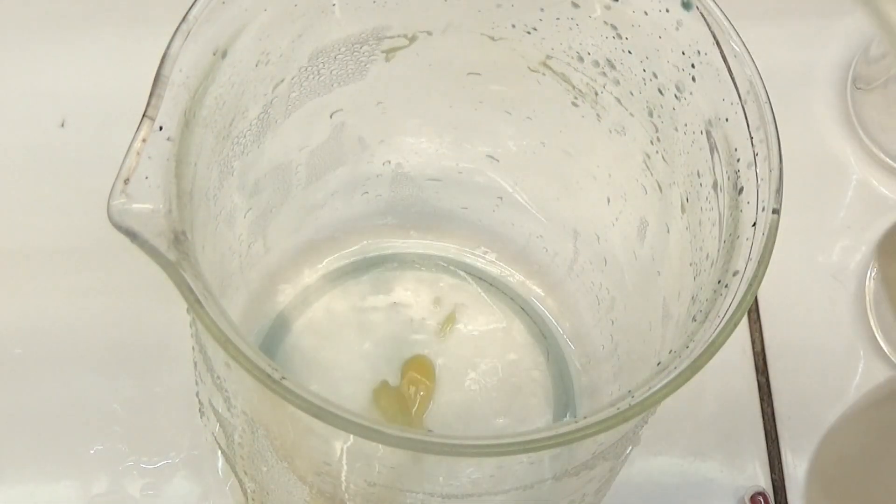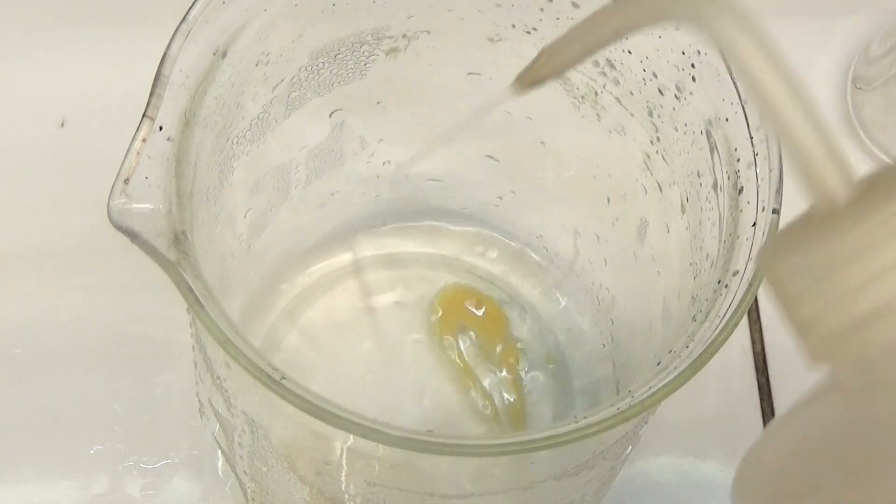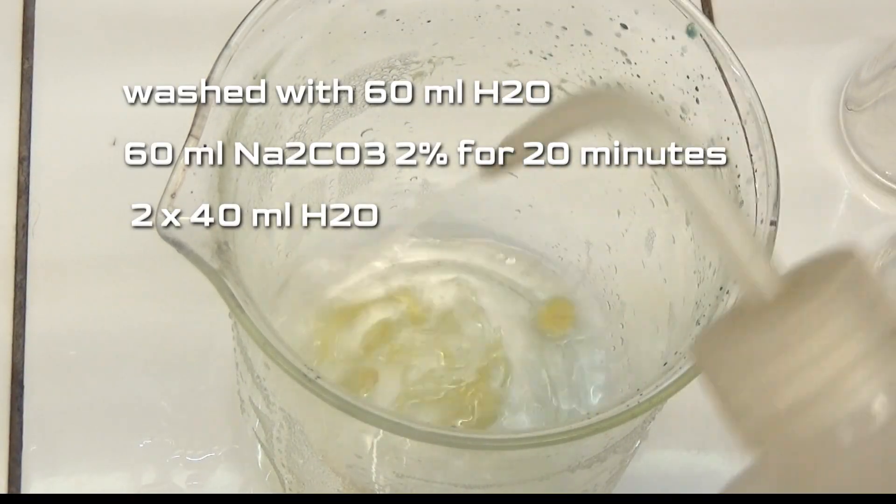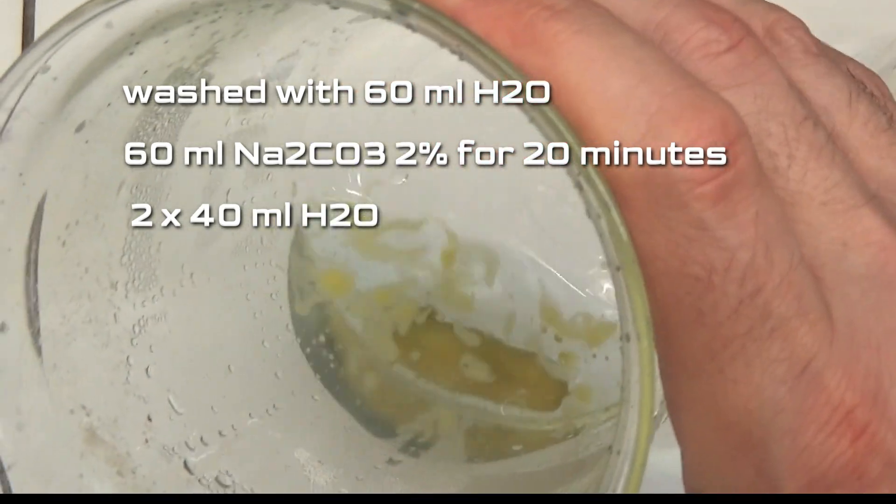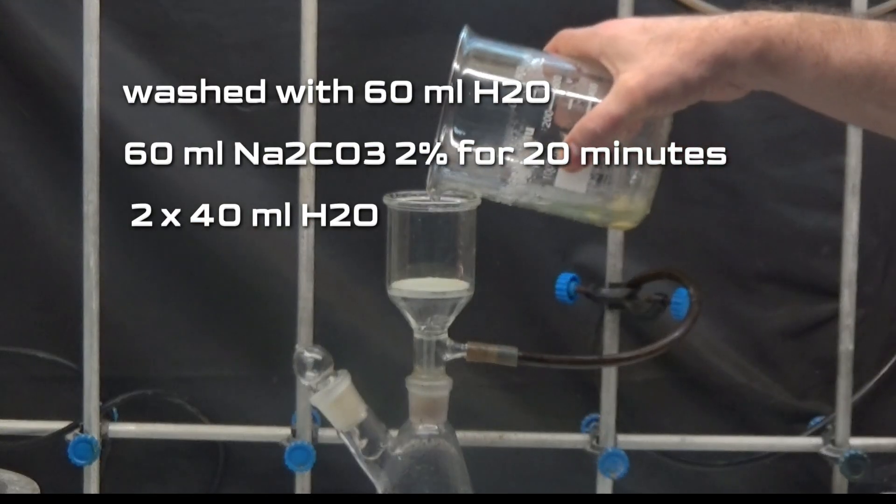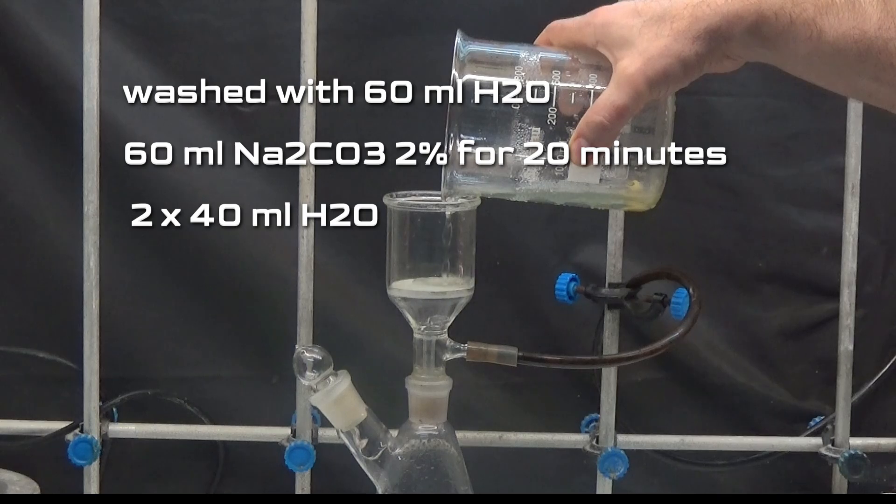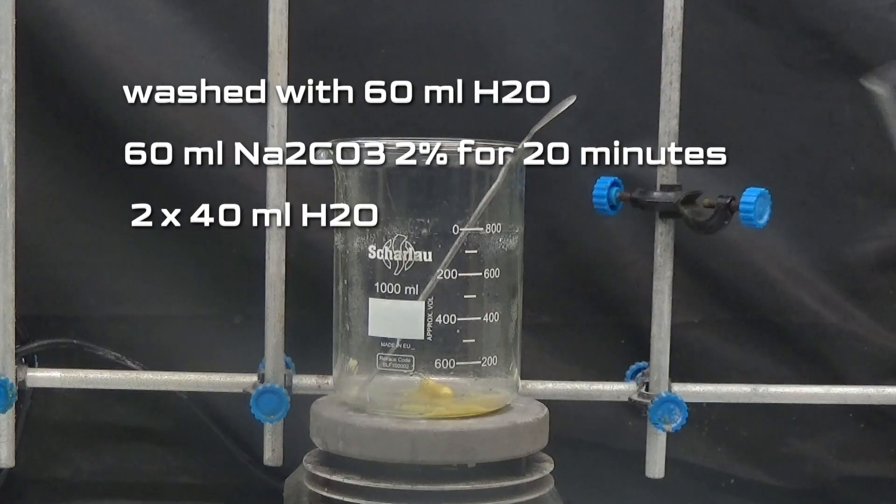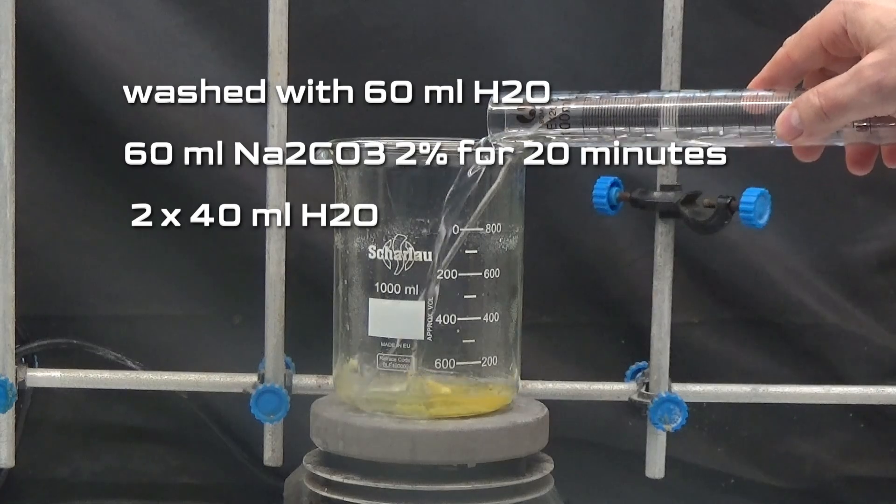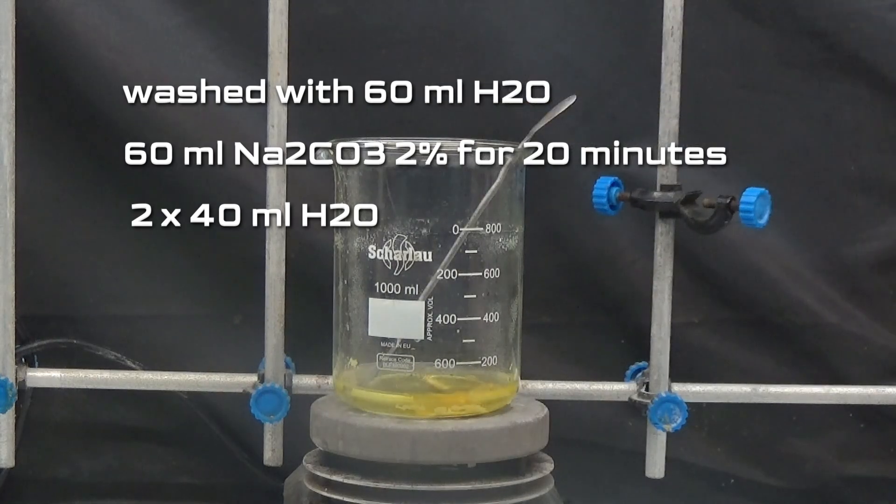The paste is first washed with 60ml of cold water. Then it is washed with 60ml of 2% sodium carbonate solution for 20 minutes.